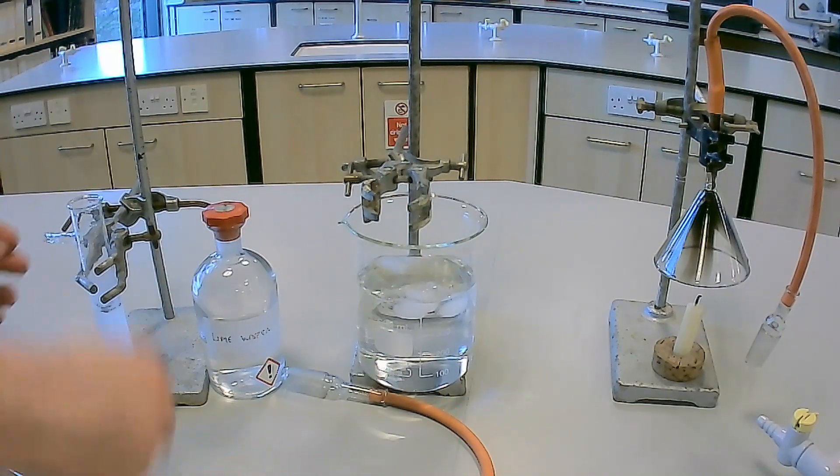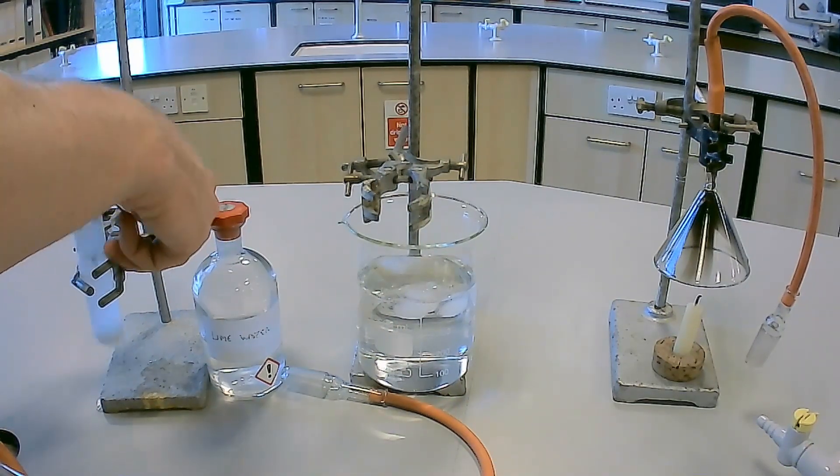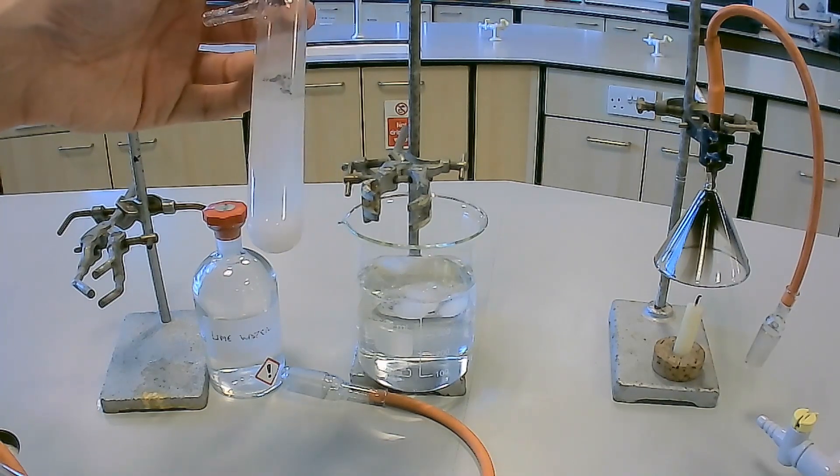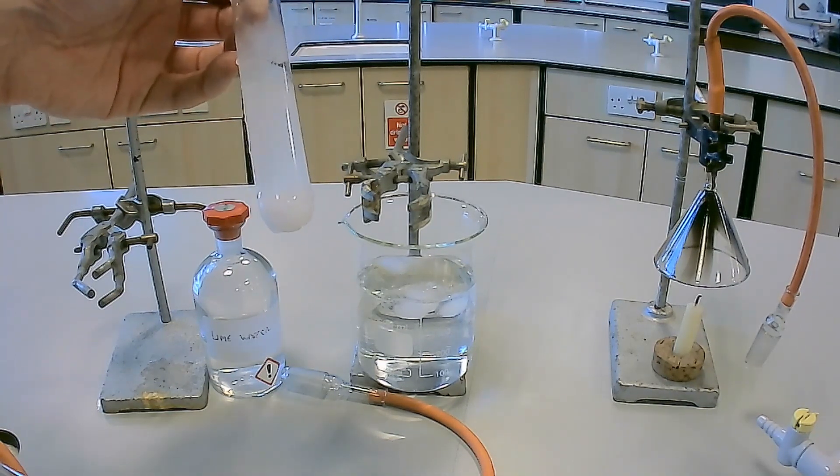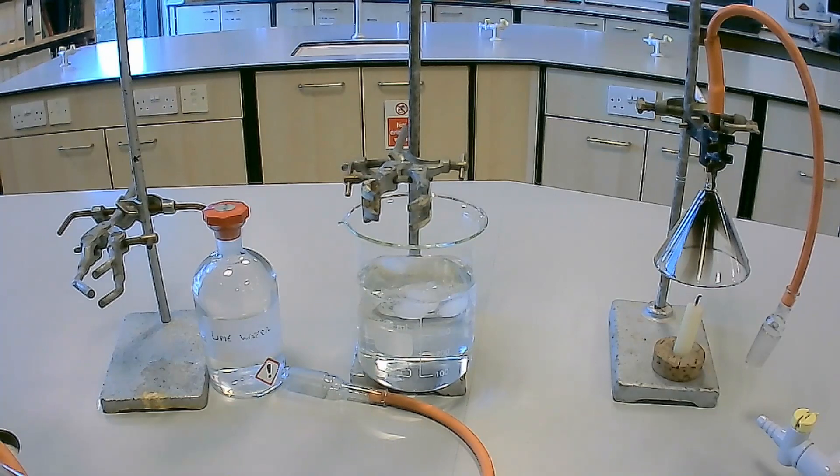Finally, as we observe the left-hand tube, we can see the presence of the white precipitate of calcium carbonate at the bottom, formed from the reaction of the lime water with the carbon dioxide in the combustion gases pulled through the apparatus.